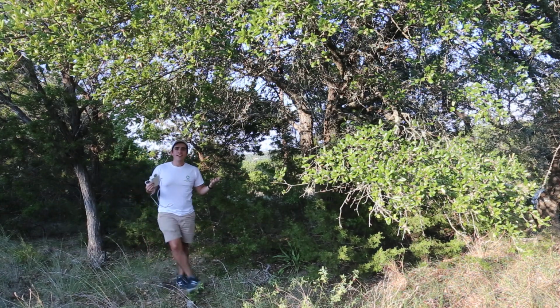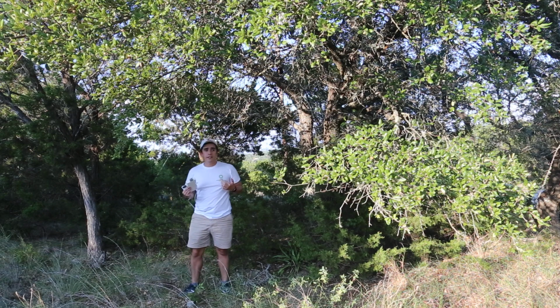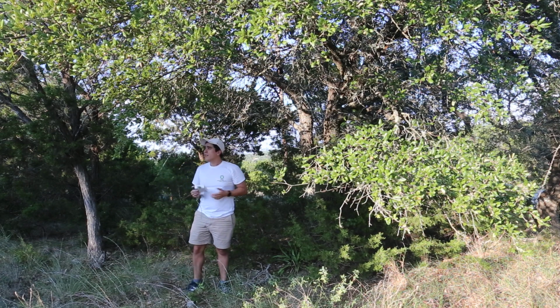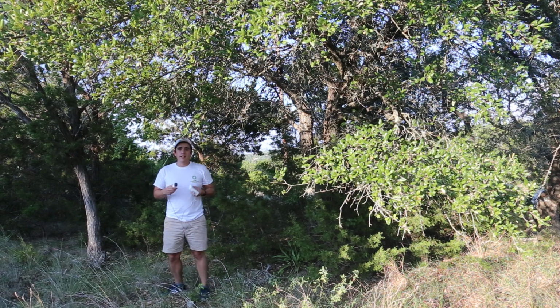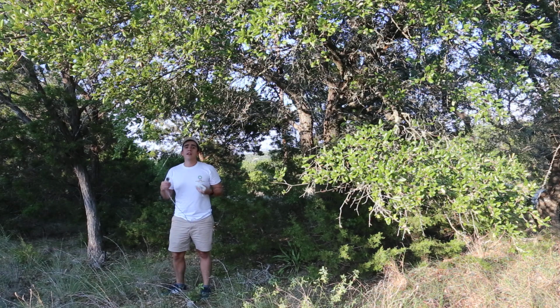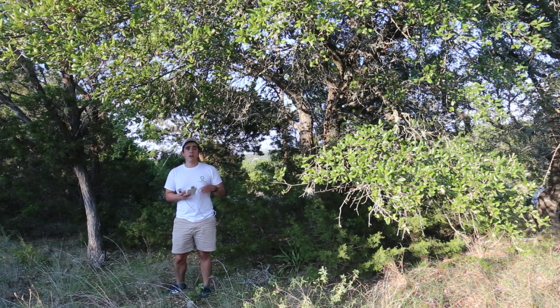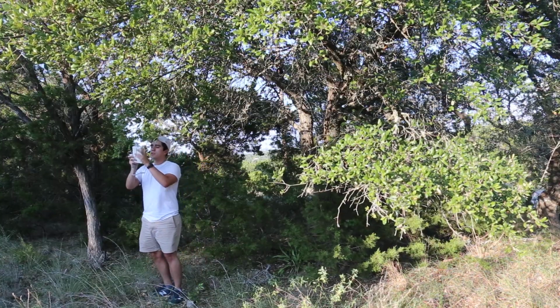Alright, everybody, so now I'm under the shade. This part of the canopy is under the shade, right? So it's not getting direct radiation. It's getting diffused radiation. So what we have here now, again, we're going to take the test 3 times. And again, the test takes 30 seconds. We'll get those measurements and we'll see if it's lower or if it's higher. So we'll commence the test now.